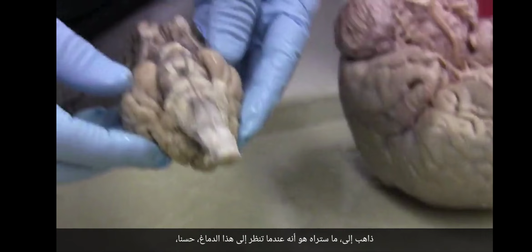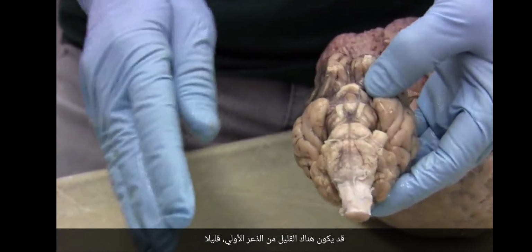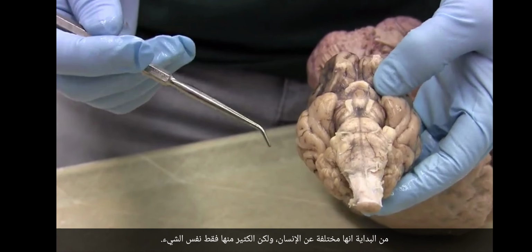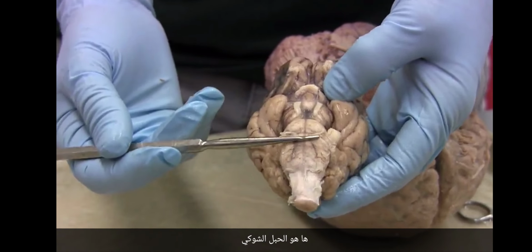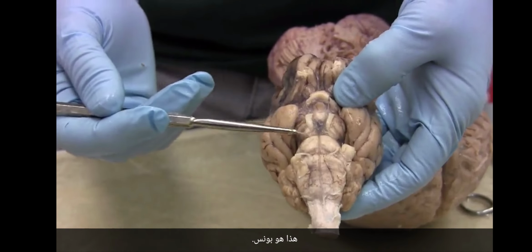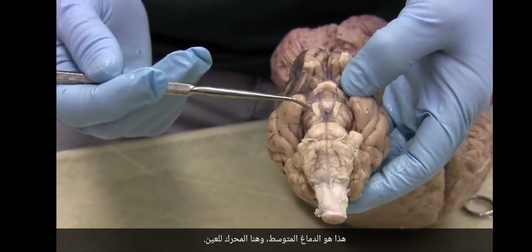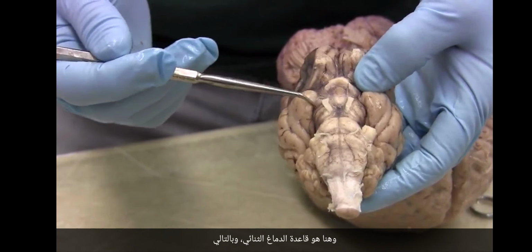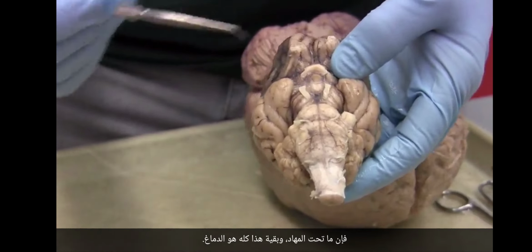And now what you're going to see is that when you look at this brain, there might be a little bit of initial panic, a little bit of initial, it's different from the human, but a lot of it's just exactly the same. Here's spinal cord, here's medulla, this is pons, this is midbrain, here's the oculomotor, and here is the base of the diencephalon, so the hypothalamus. And the rest of this is all telencephalon.